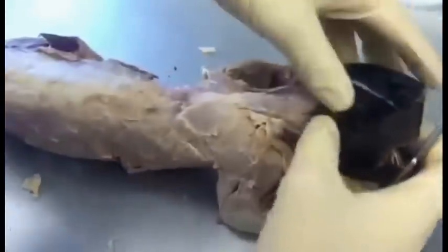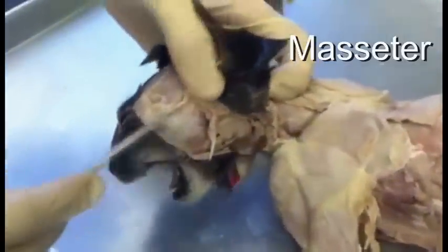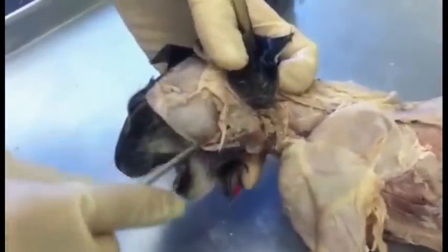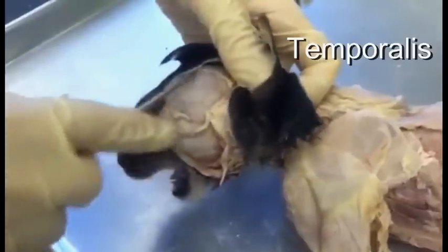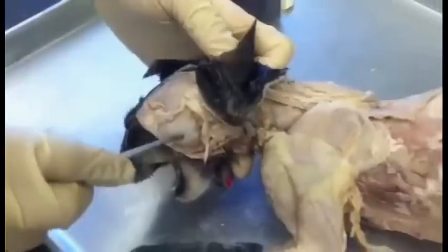Going up and turning the specimen around, there are two muscles on the head you need to know. The masseter muscle is the big muscle that closes the jaw. And then the temporalis muscle — this is where the temporal bone is — is the temporalis.